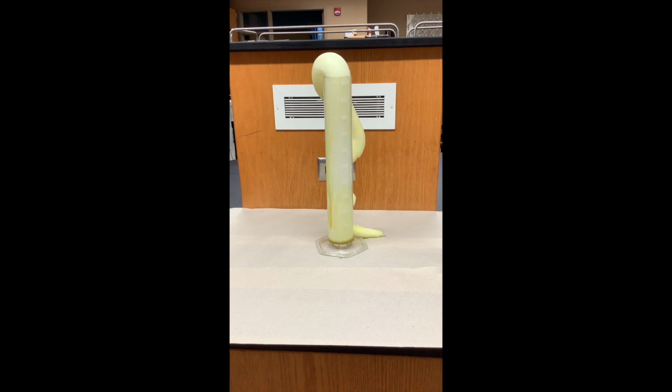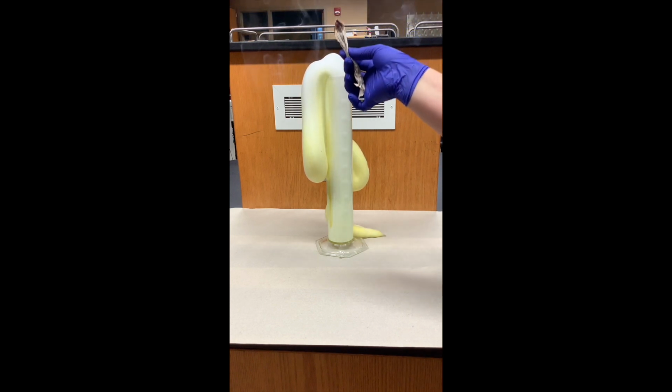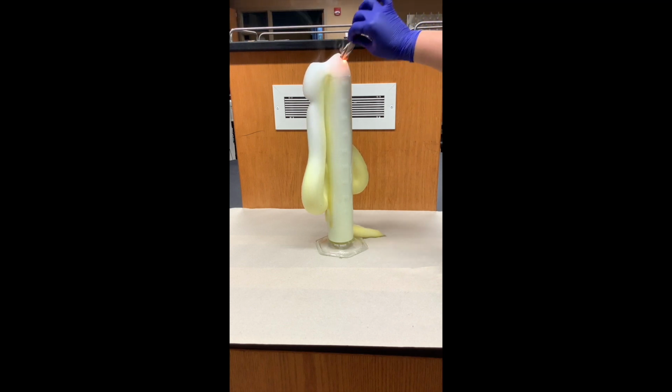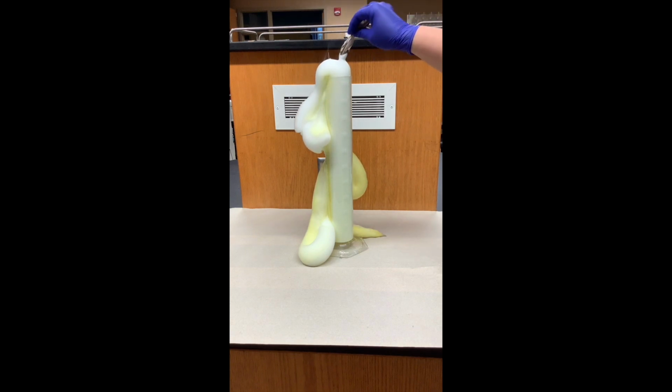So we're going to test whether this actually forms oxygen gas using a splint test or just a piece of burnt paper. So oxygen is one of the reagents for combustion. So it will support combustion. And if I insert that burnt out splint, it actually reignites in that oxygen atmosphere. So it'll keep doing that until the paper gets wet from the bubbles, which is what happened that time.